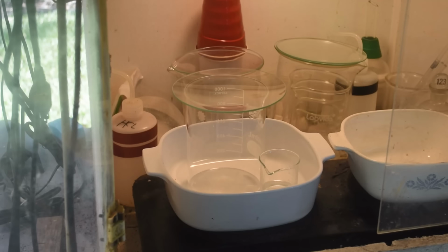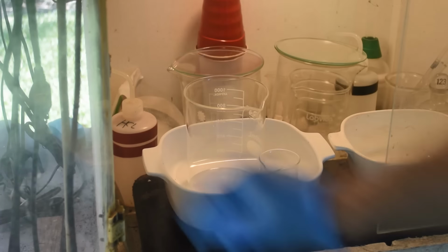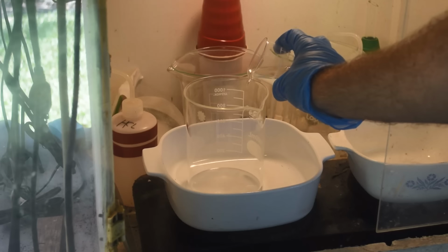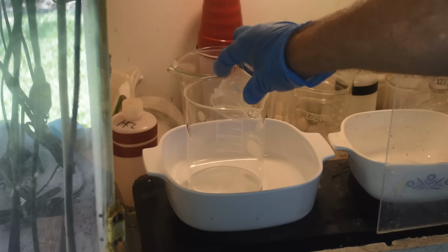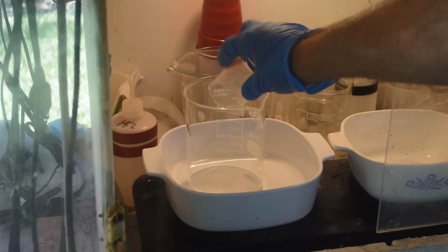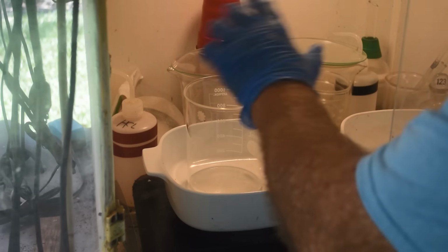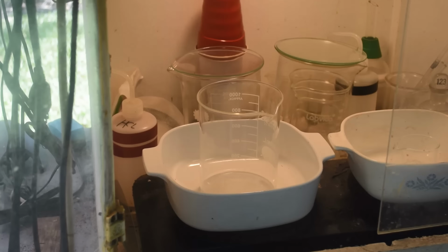All right, the next steps are going to be carried out in the fume hood, so I don't have to smell this stuff, get gassed by it. We're going to dump the formic acid in this bigger beaker. Now, I'm not heating anything here. I'm just doing this in the fume hood so I don't have to smell anything, like ammonia.